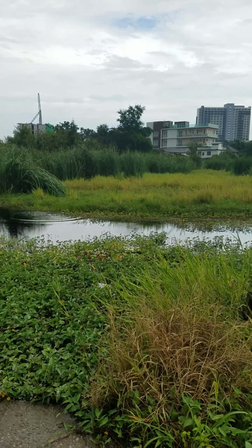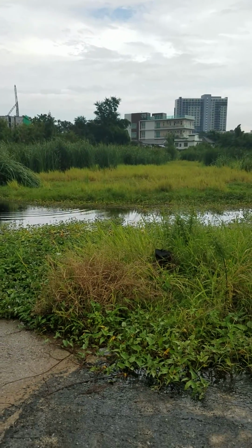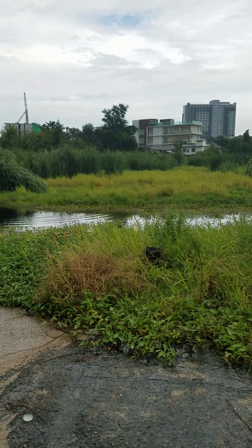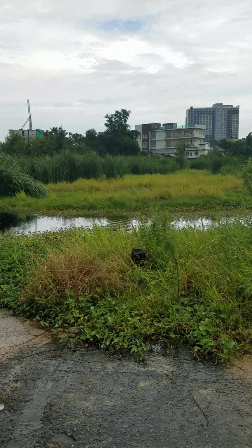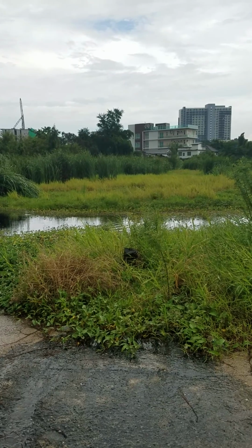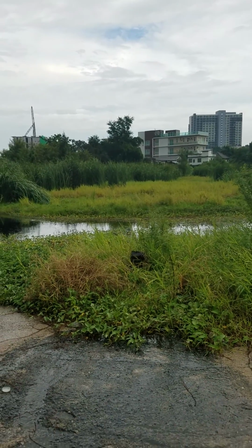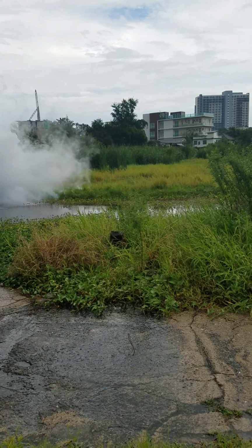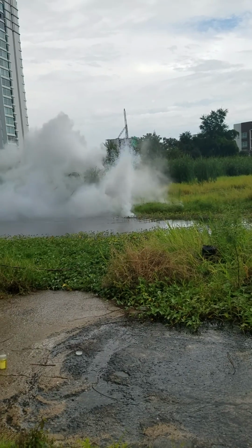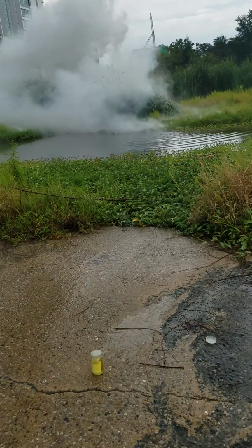I'm a little scared. I'm gonna back up. I'm gonna keep backing up. It's gonna explode very soon, and here we go. Get ready. I'm gonna back up a little more. That was one. Whew.